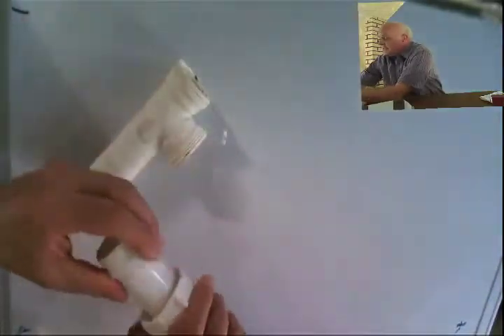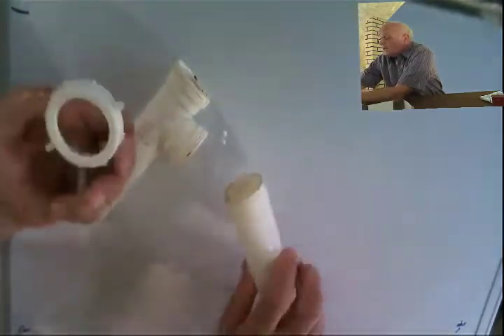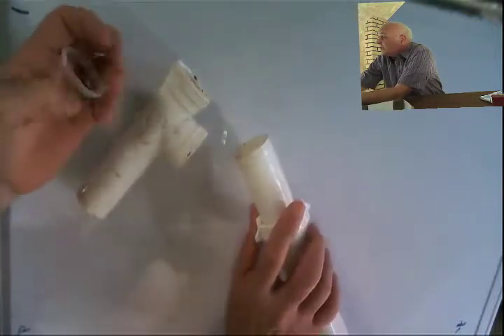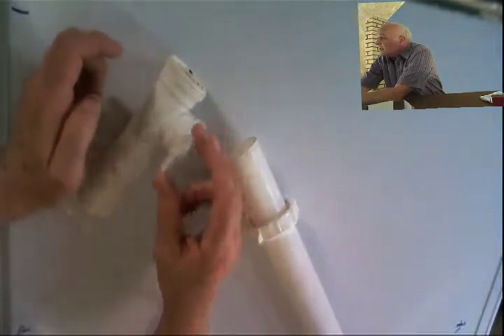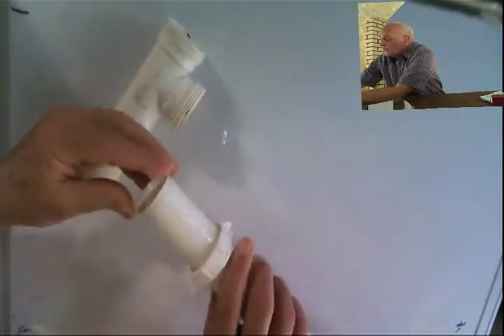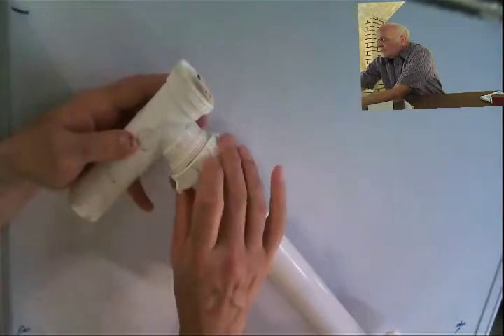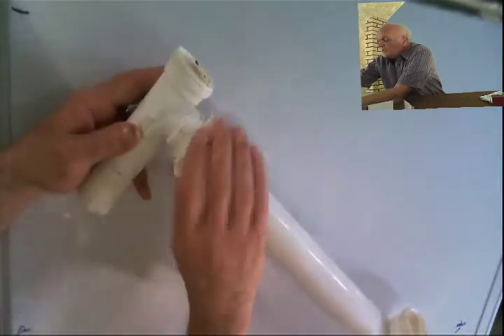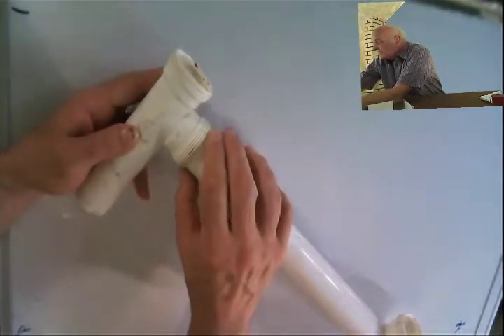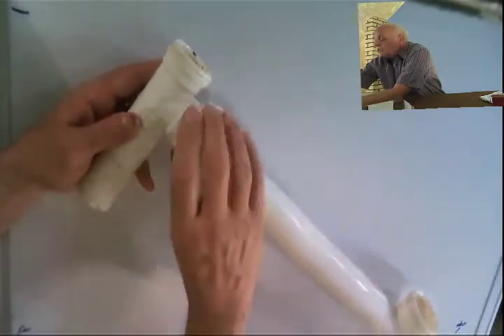This looks like it came out of a bathroom, and in fact it did. Notice our working parts: we have a washer, which I think of as a ferrule. I don't think plumbers call it that, but whatever. There's a nut, and then this would be the column. So put the nut on, put the washer on, and notice this washer is tapered such that it fits right in here exactly. Put the whole thing in here, and as this turns around and is tightened up, it pushes this washer into the groove around it and makes the seal. The engineering for the GC column is identical.